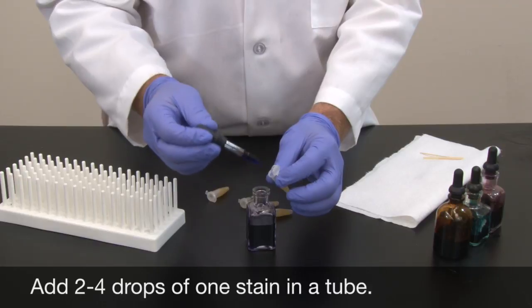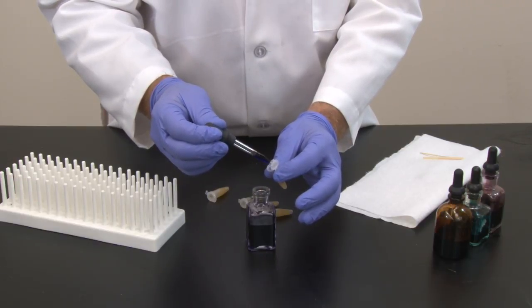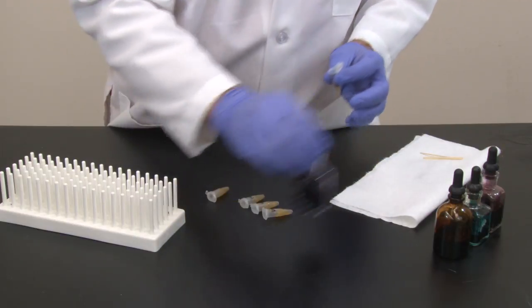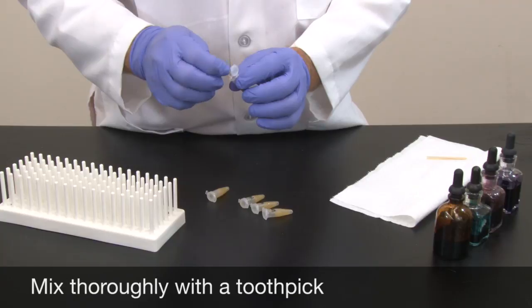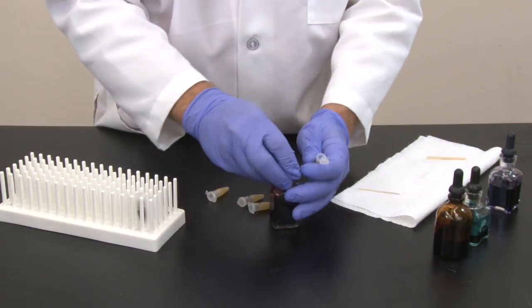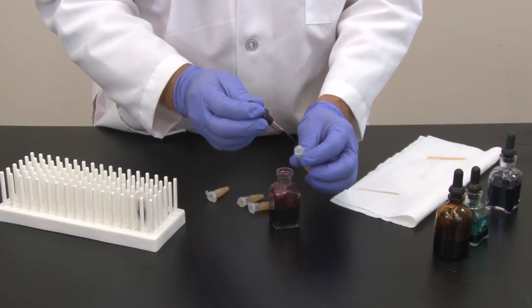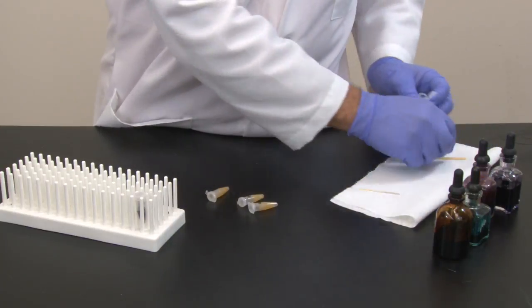Next, add 2 to 4 drops of a single stain to a tube. Here, toluidine blue is being added to the homogenate. Mix the tissue and stain with a toothpick and place on a rack and allow the stain to color the cells for 10 to 15 minutes. Continue adding stain to each of your tubes until all of your tissues have been stained with the different stains that you will be using.